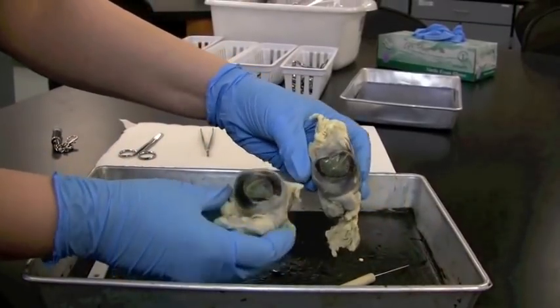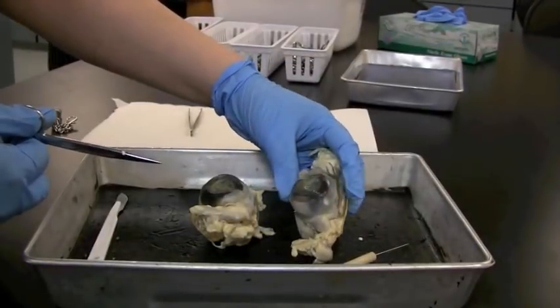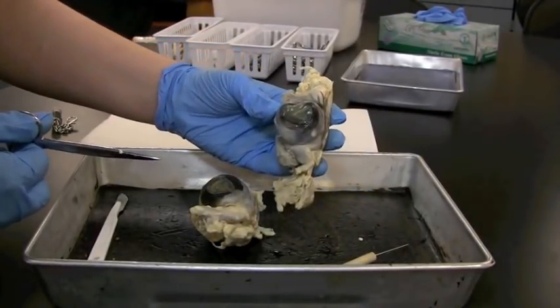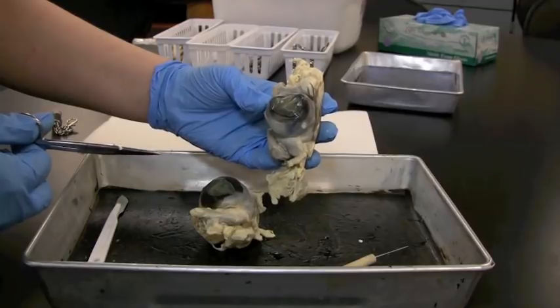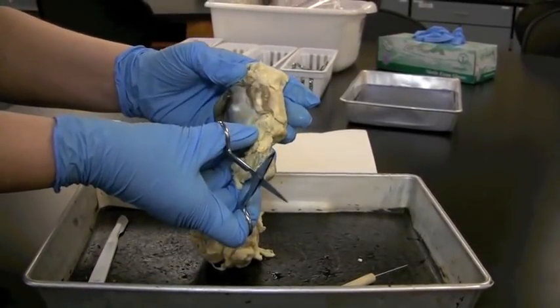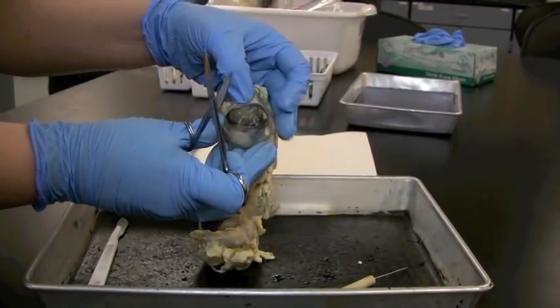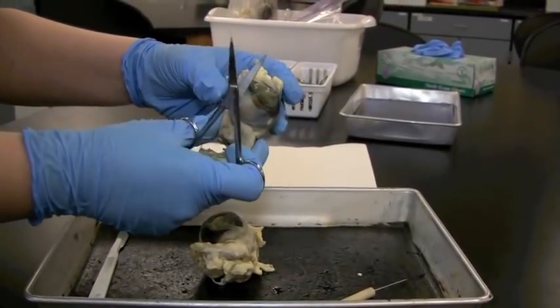Here we have our cow eyeballs. I'm going to have to trim away quite a bit of tissue here, all of this fat and connective tissue that's surrounding the eyeball. We just want this portion, this round ball that's sitting in here. It's pretty tough material.